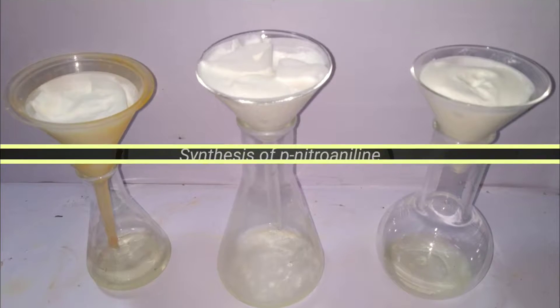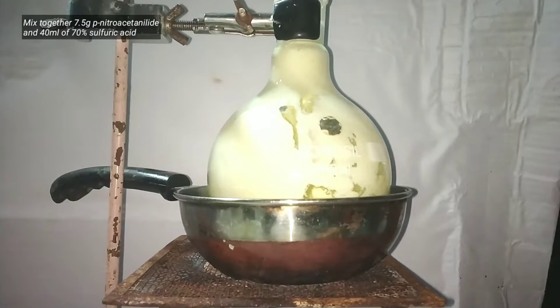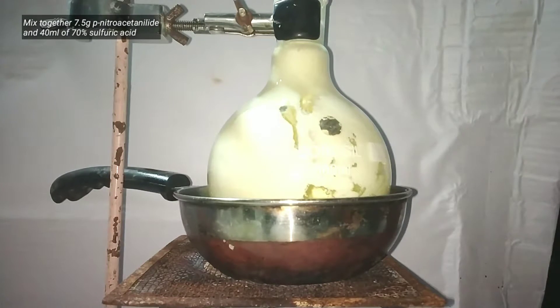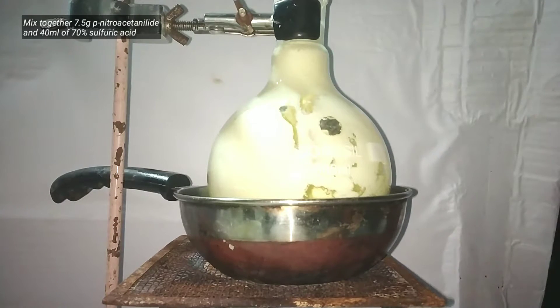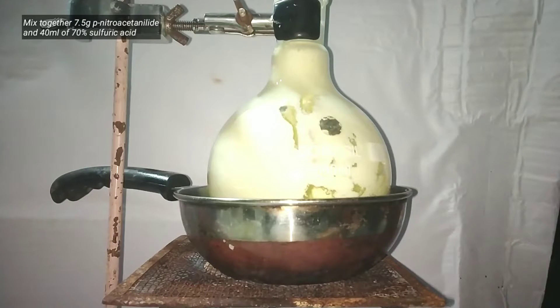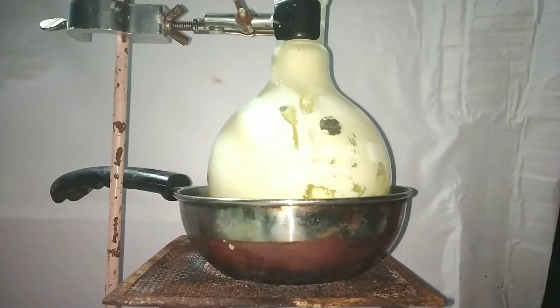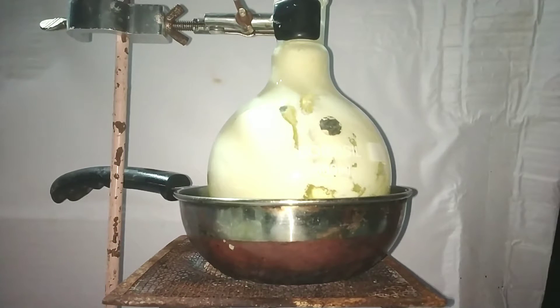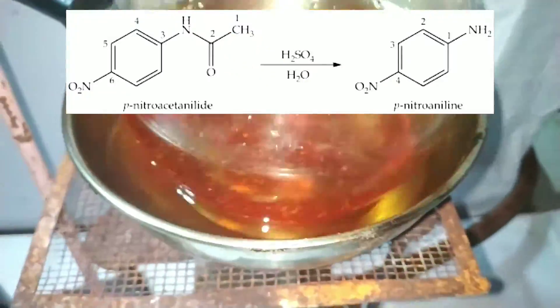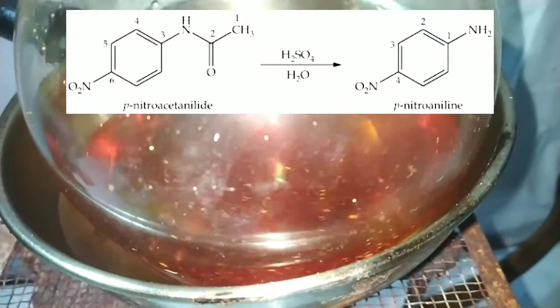The crude product can be directly used for the next part, which is the synthesis of paranitroaniline. For that, we heat a mixture of 7.5 grams of paranitroacetanilide and 40 ml of 70% sulfuric acid in a 500 ml round bottom flask fitted with a reflux condenser on top. The flask was also placed in an oil bath. After heating for some time, the precipitate dissolves and the solution becomes clear — this is the hydrolysis of paranitroacetanilide to paranitroaniline.